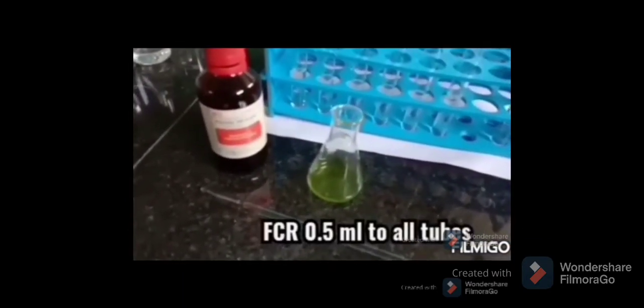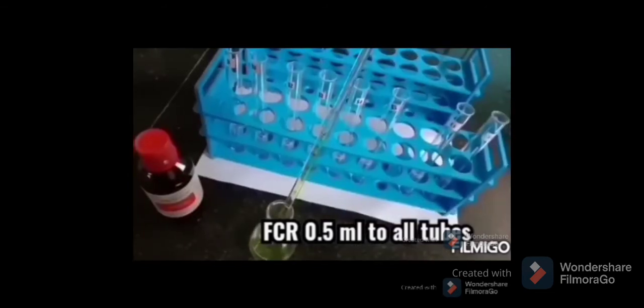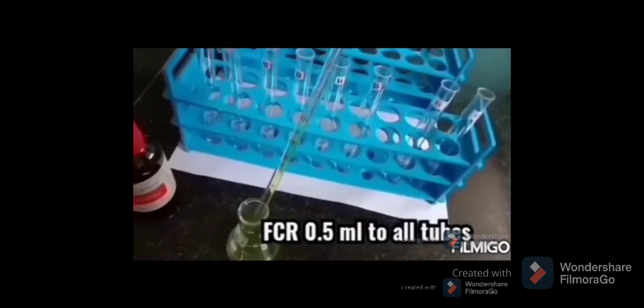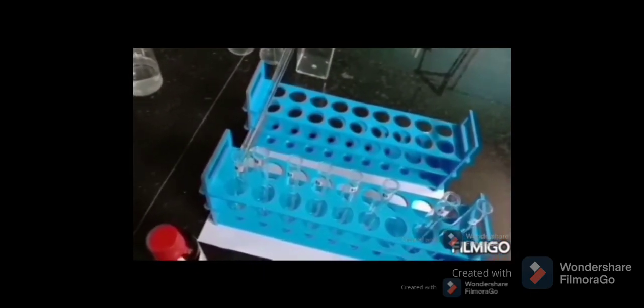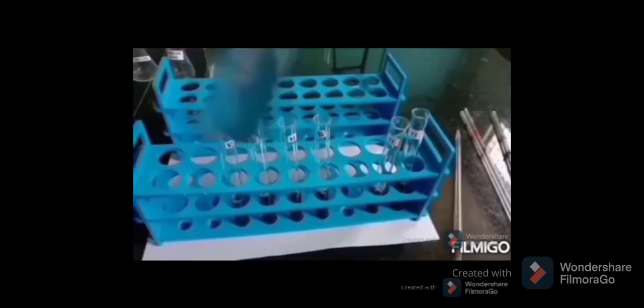After incubation, 0.5 ml Folin reagent is added to all tubes. Folin reagent is actually prepared fresh by mixing distilled water and Folin reagent in 1 is to 1 ratio.